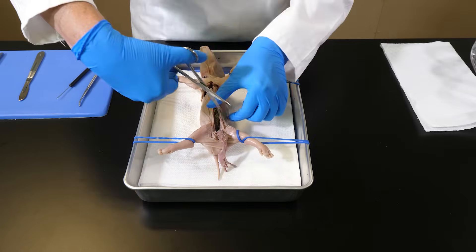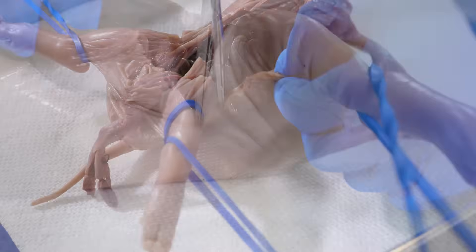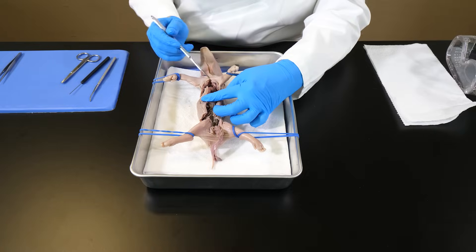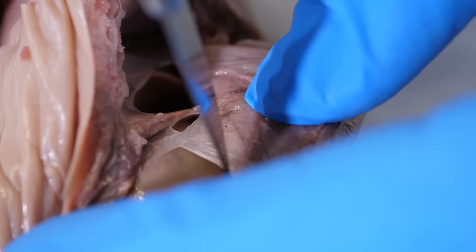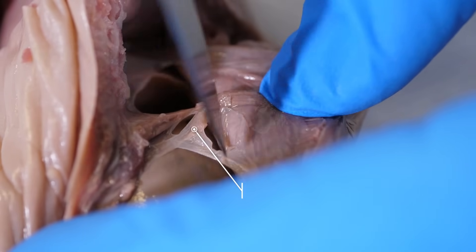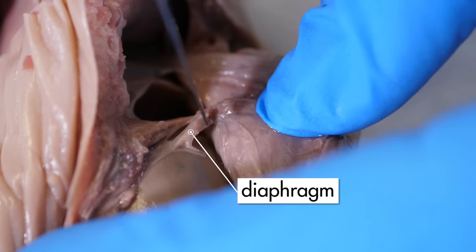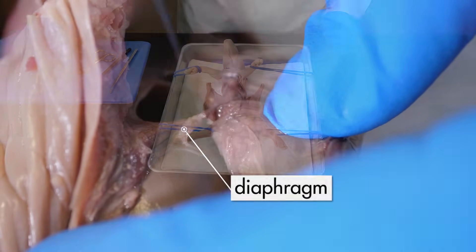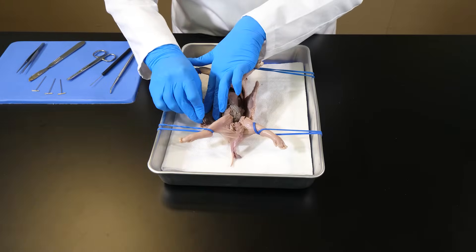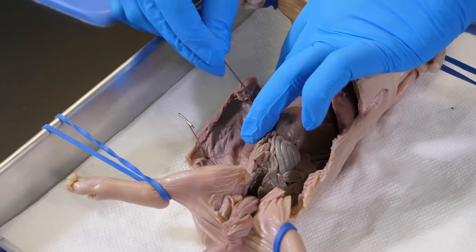After moving the umbilical cord, we cut along the transverse incisions near the hind legs. Now we can cut away some of the diaphragm that is attached to the body wall. To get a clear view of the internal organs, we secure the skin and muscles of the body cavity with pins.